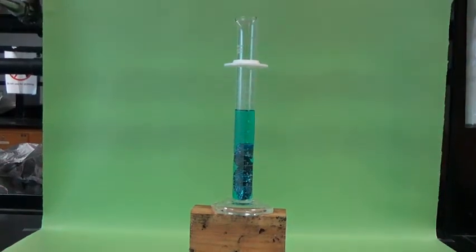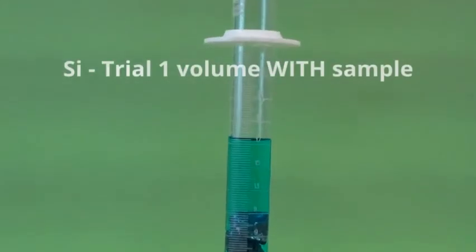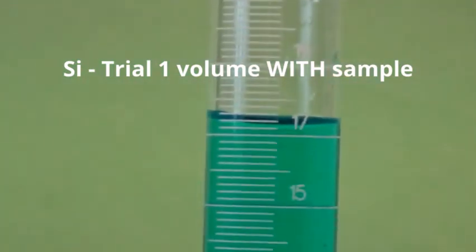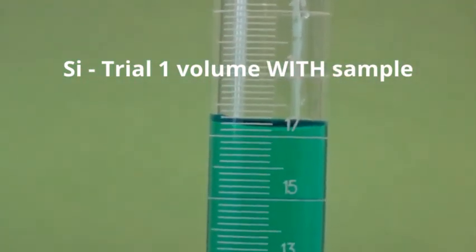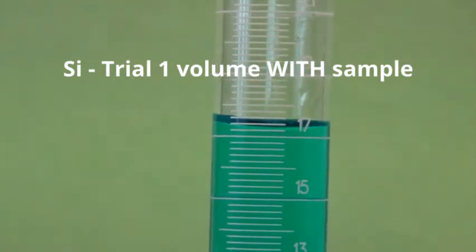So now we're going to zoom in and see what that new volume is. Right about there. Turn it ever so slightly. And that's your final volume.